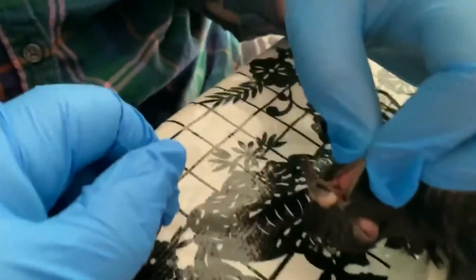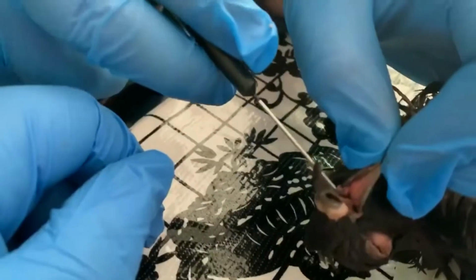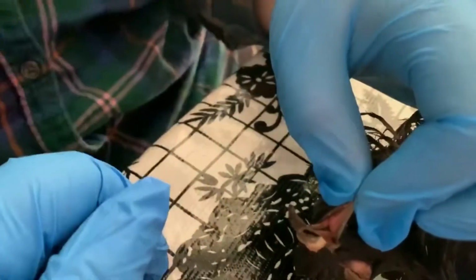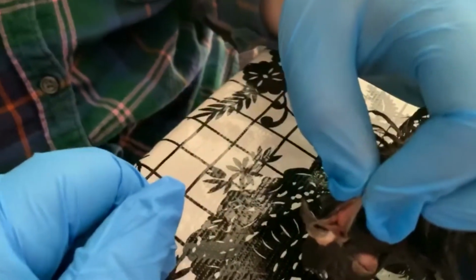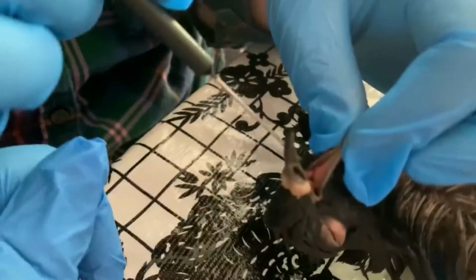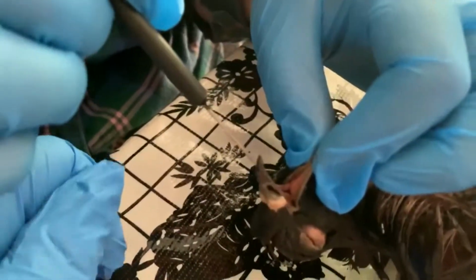Okay, pigeons have tongues. The tongue is used to help manipulate the food, similar to how we use our tongues. Their tongues are narrow and sharply pointed. We also have what are called palatine folds. These are fleshy folds that extend from the lateral borders of the upper jaw to the midline.